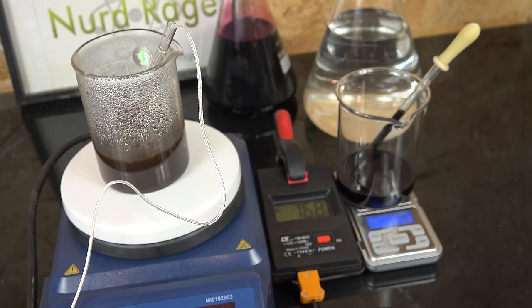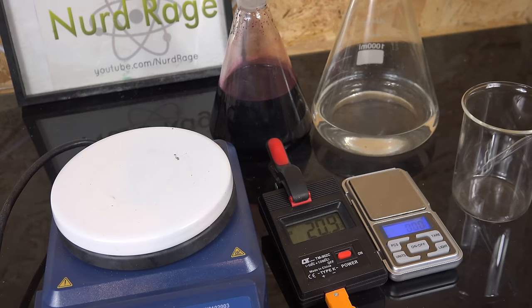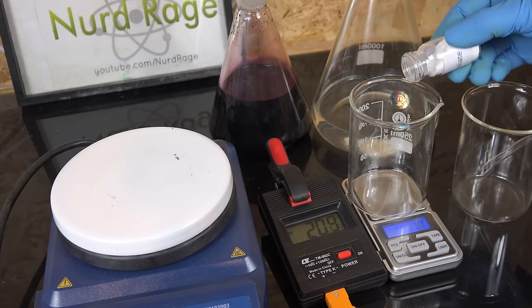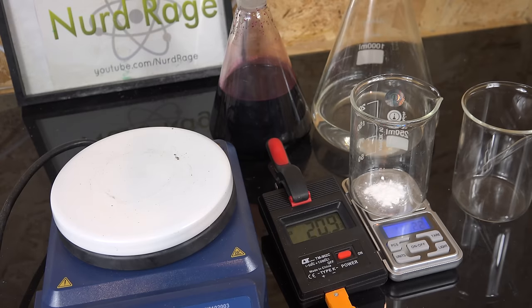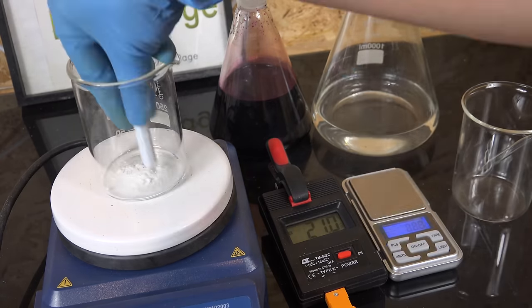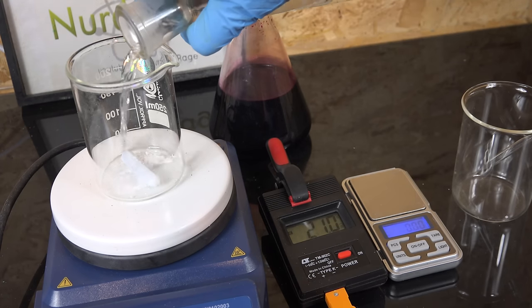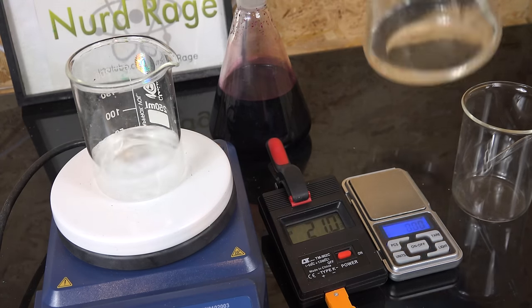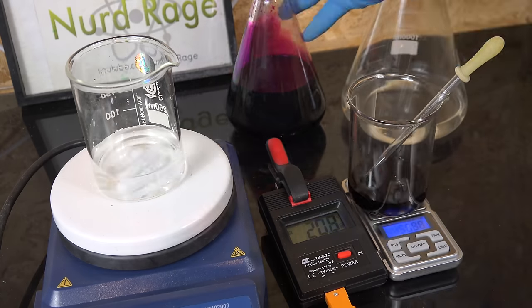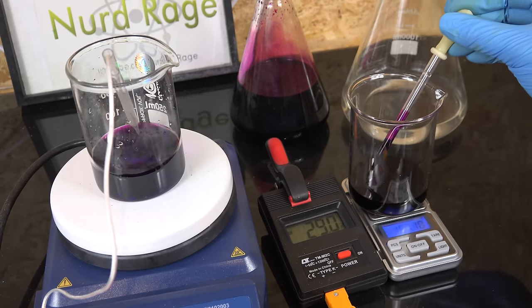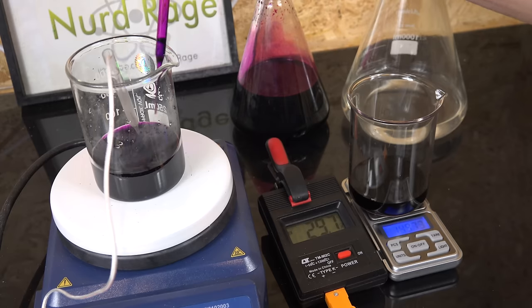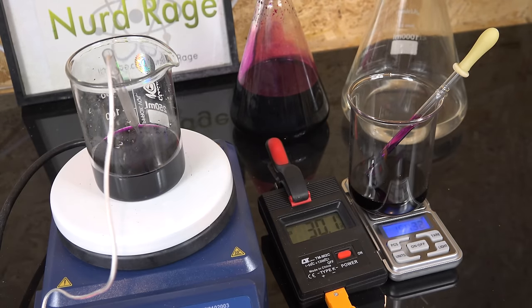Looks like I used about 11g of permanganate solution. Now we wash out our titration and do this again, but this time we're not practicing, this is a precision trial. Once again we weigh out 1g of sodium oxalate but record how much we actually use. We add in our supporting titration mixture and before we even heat up, we add in directly about 90% of our expected titrant. Since we used about 11g, I'm adding in about 10g.